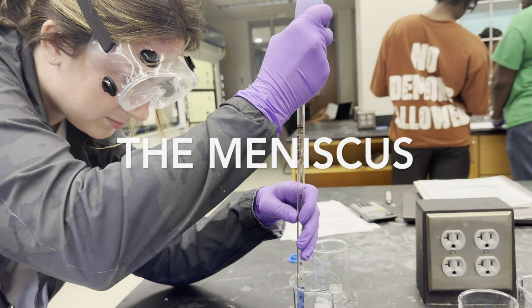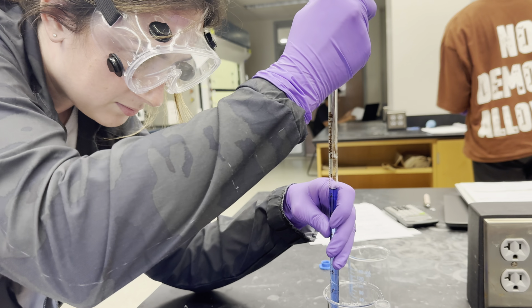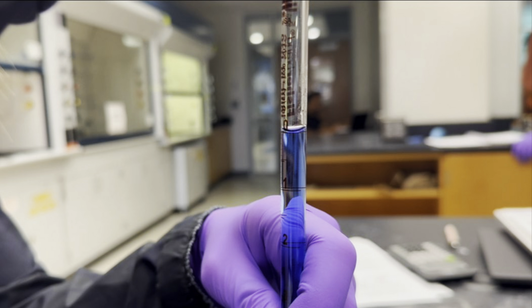Now we're starting dilution 1, but first let's talk about the meniscus. A meniscus is the curved surface of a liquid in a container, such as a pipette or a graduated cylinder. It forms due to surface tension and the adhesion between the liquid and the container walls due to intermolecular forces between the liquid molecules in the container. For water and other polar liquids, the molecules adhere to the container, creating a concave meniscus. Meniscus are read by reading the bottom of the meniscus at eye level.